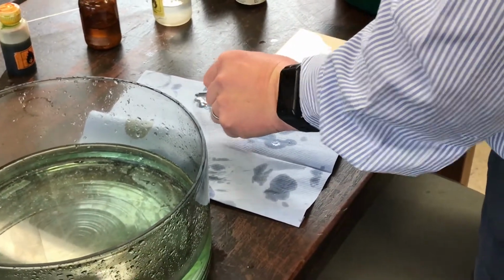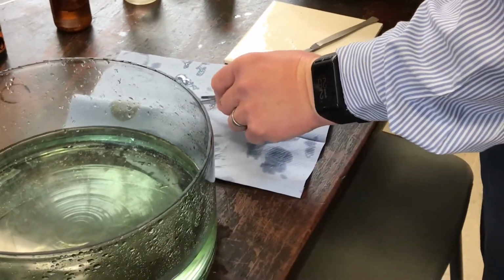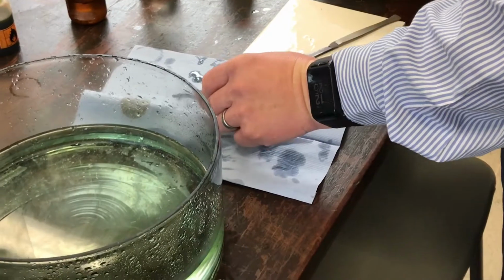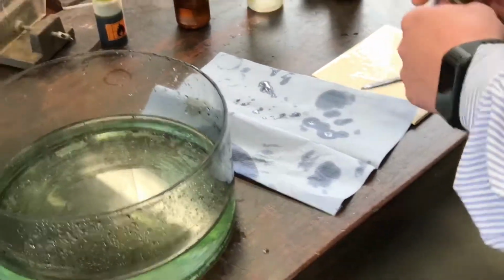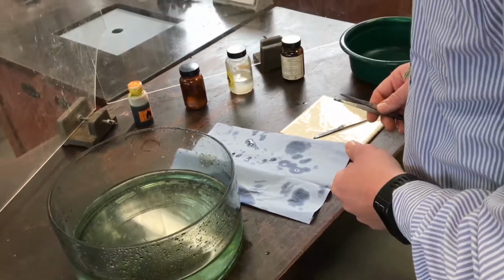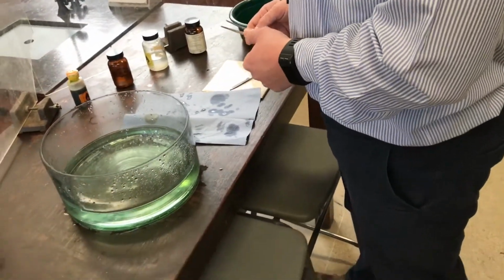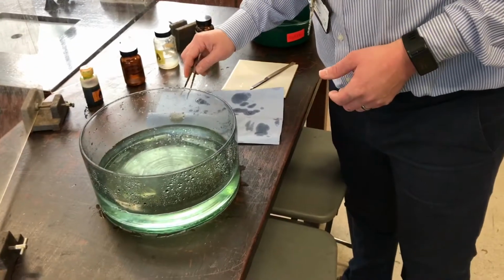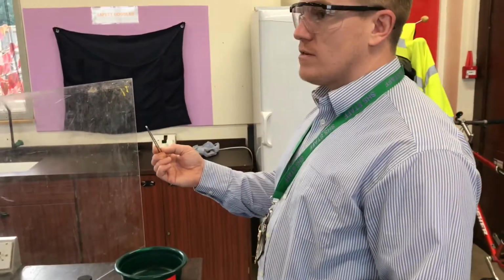It's all going to bubble up. We know that's going to happen. Does anyone know what other sort of energy might be shown, dispersed, doing this? Yep. Heat. Well, we got heat already. Foamy energy. I've not heard of that one. We've got smoke, we've got heat. Light. Yeah, light. So, again, very silvery, very, very soft.